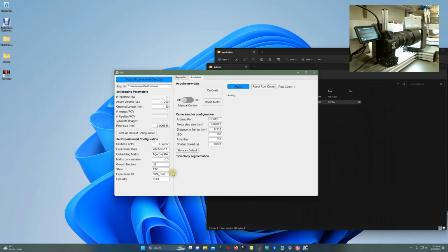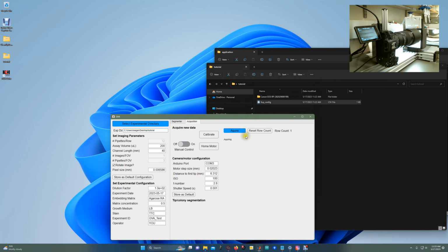Importantly, it does not allow you to change certain parameters after you've begun imaging a file, and that's because these are parameters that are required for the segmentation to work. So in order to change those parameters again, you have to select a new experimental directory, and those parameters, such as number of pipette tips per row, are re-enabled. So for a single experiment, you must have the same number of pipette tips per row for the whole box, even if they're just empty pipette tips in there.